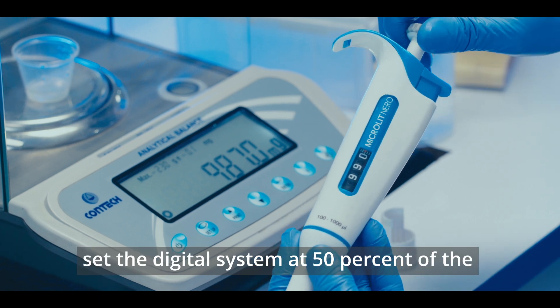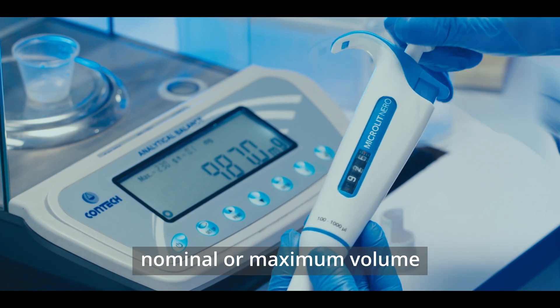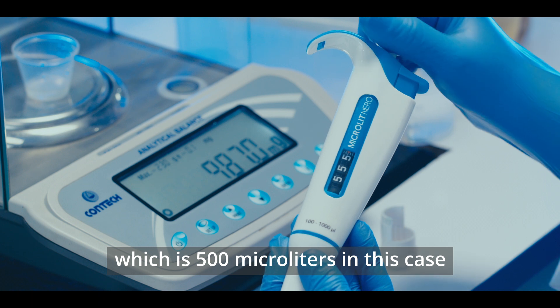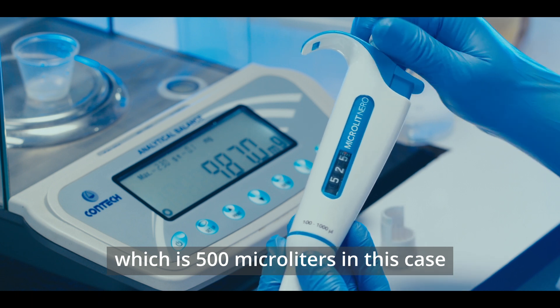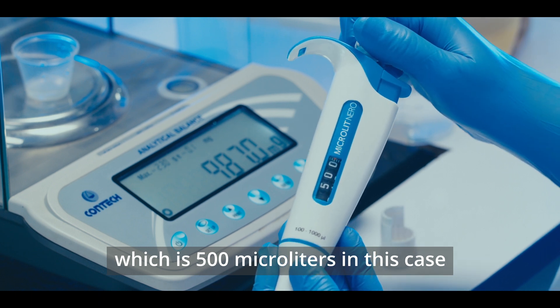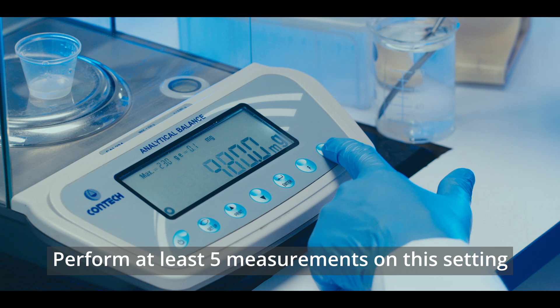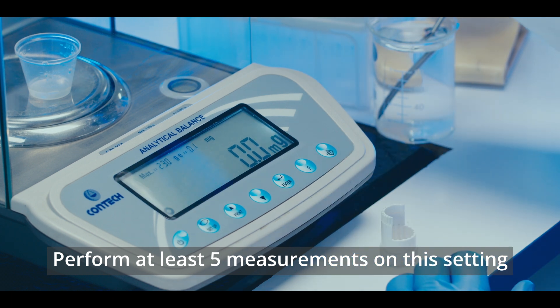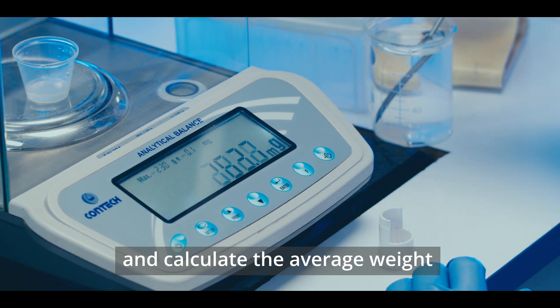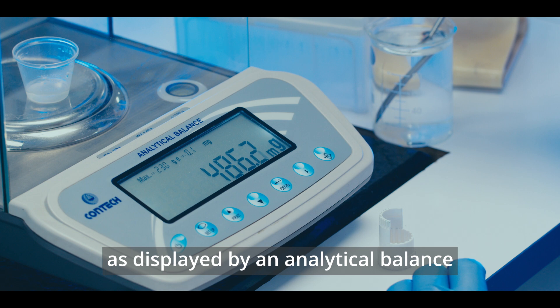To calibrate the pipette, set the digital system at 50% of the nominal or maximum volume, which is 500 µL in this case. Perform at least 5 measurements on this setting and calculate the average weight as displayed by an analytical balance.